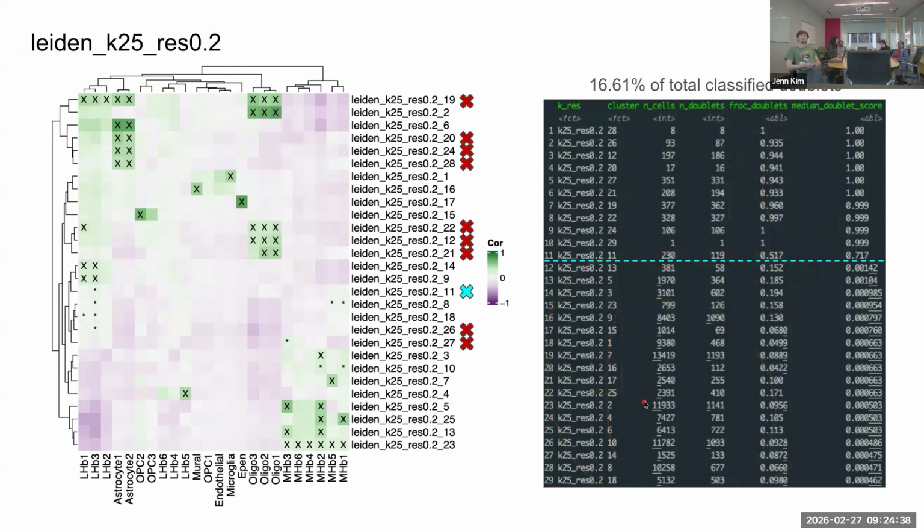You don't really have clusters that are N of 1 or N of 5, and you're maximizing the percentage of original labeled doublets that you're dropping. So this is a way to consider both the original calls that ScDblFinder gives you while also looking at your data a little bit more and not throwing away too much of the data. So if you had just gone with the strict cutoff of using singlet versus doublet labels, that removes around 11% of the data. So here we're trying to keep as much of the precious data as possible by assessing the doublet scores a bit further.